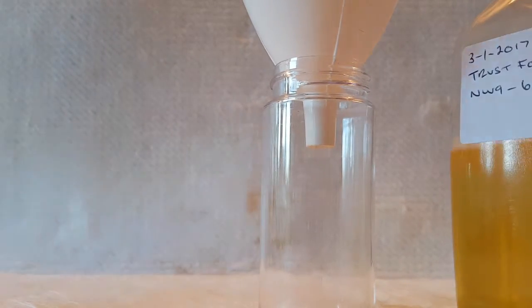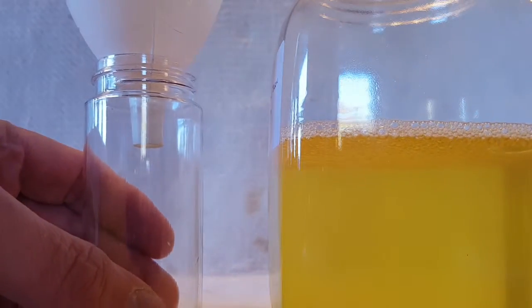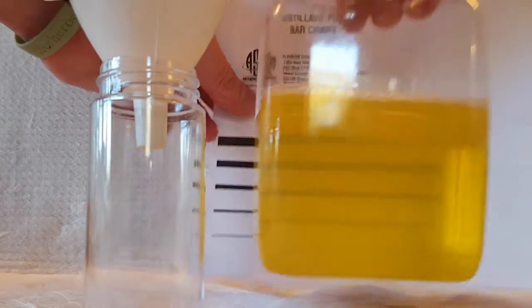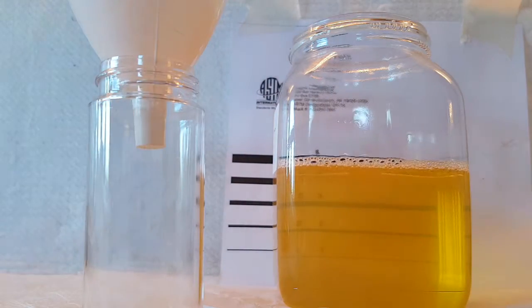So I've got some diesel here that's got a very high level of dissolved water in it, which can clearly be seen. I'll put a bar chart behind it as well. Alright, so there's a haze there on the black bar — you see it?